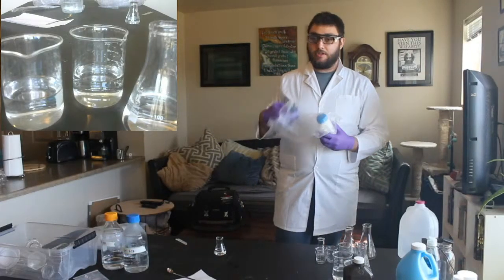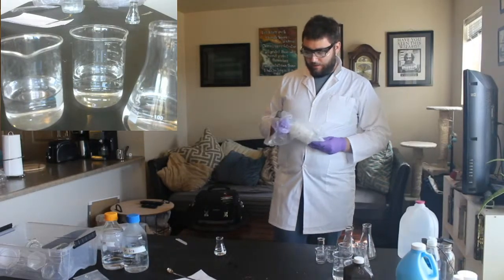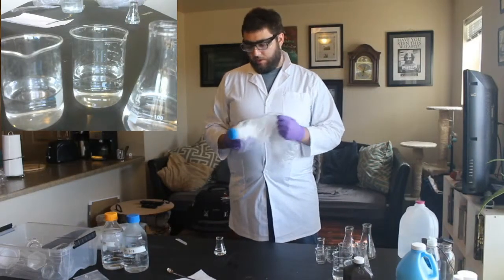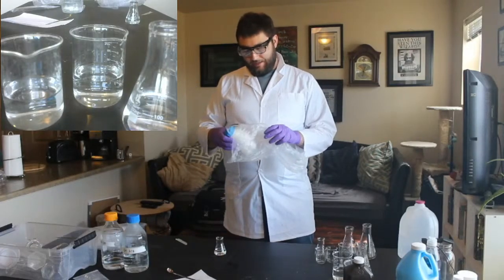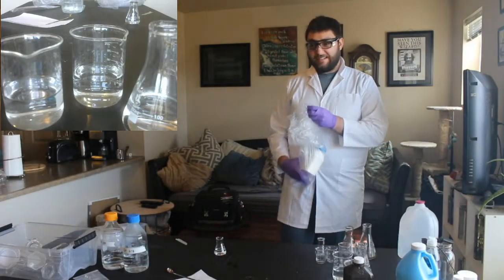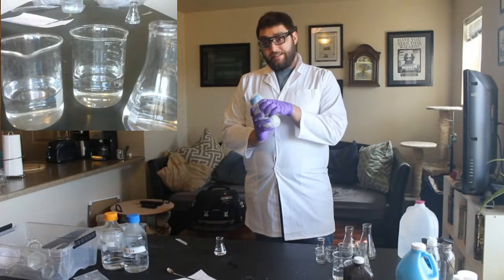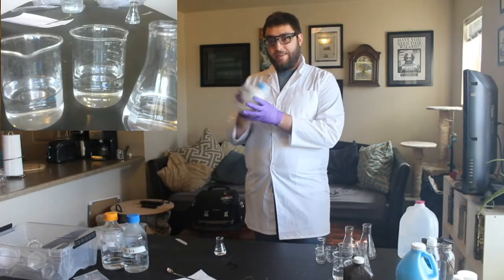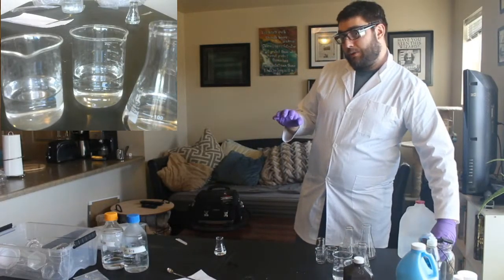So just to start off, what we're working with for these first three solutions, and you should see those three solutions on the close-up screen there, is this chemical called lead nitrate. Now, lead is a heavy metal. It's really, really dense, and it's poisonous. So I have to be really careful. That's why it's wrapped up in this, and that's why I'm wearing gloves today. But it does some really cool stuff.